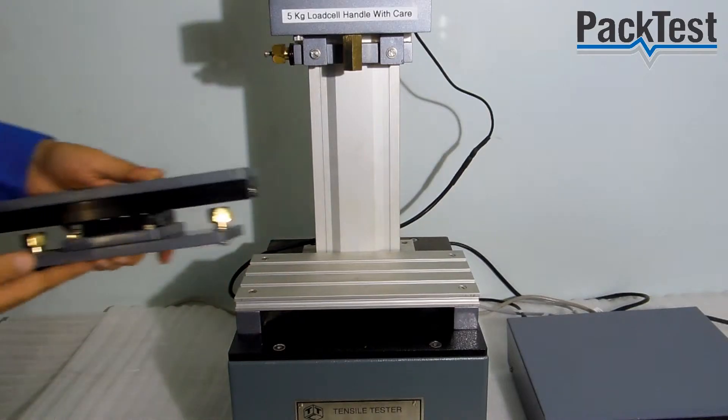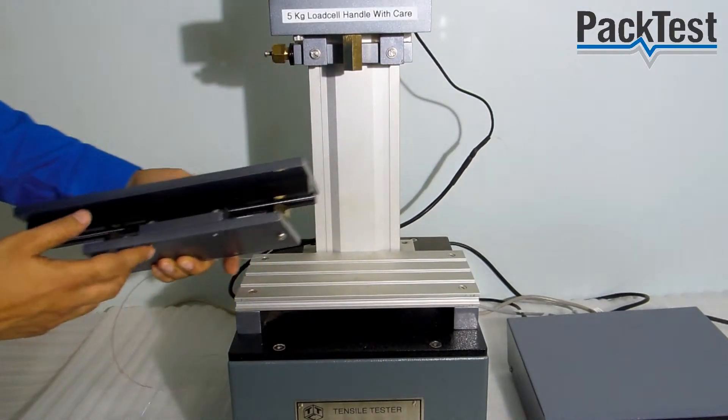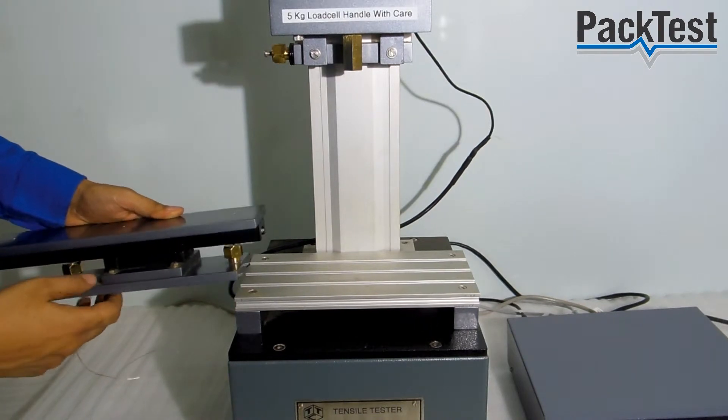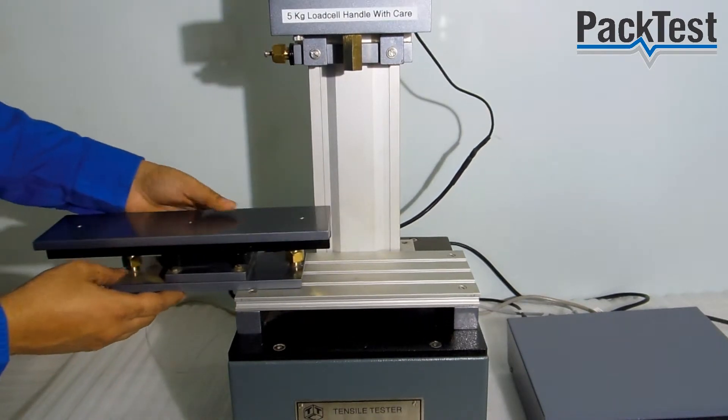Now let's set up the machine. Slide the base plate into position and tighten the bolts to hold it in position.